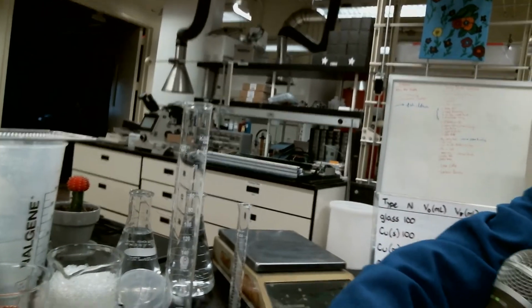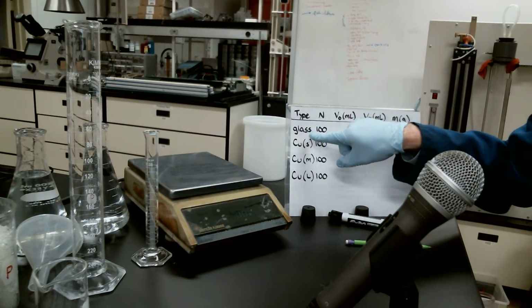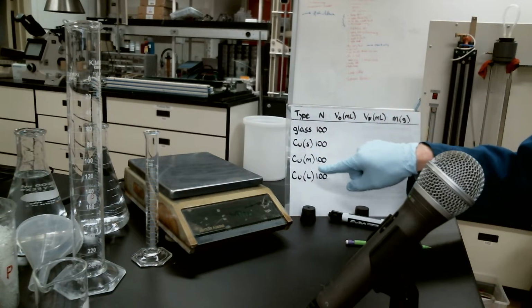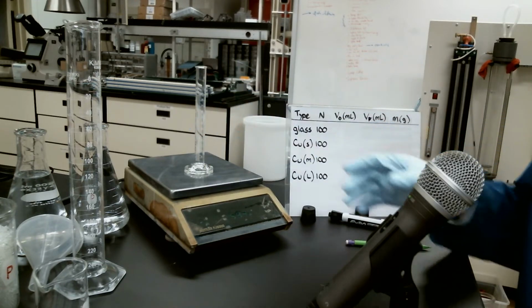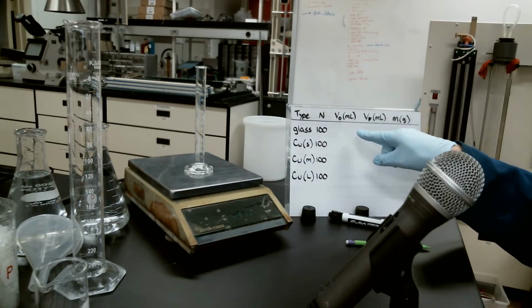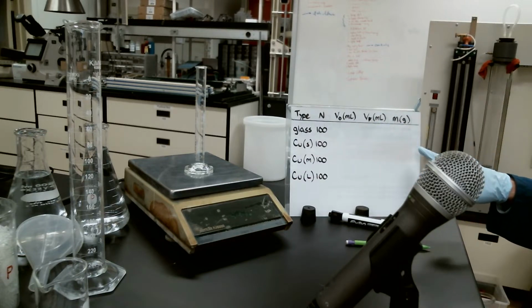But I'm also going to show you a little summary table each time we take a measurement here. So it's not like you're going to actually need to see what each one of these are doing. Back here on the table, I've already summarized that we've got glass, copper, copper, copper, and the copper comes in 3 sizes, small, medium, and large. What we're going to do is start off with a known volume of water inside each one of these graduated cylinders. We will tare that on our scale. Obviously, we will write down what the initial volume of water was, and then we will pour the spheres inside of there, measure the new volume, so that would be the amount of volume displaced by the spheres, as well as what the mass reading is on each one.